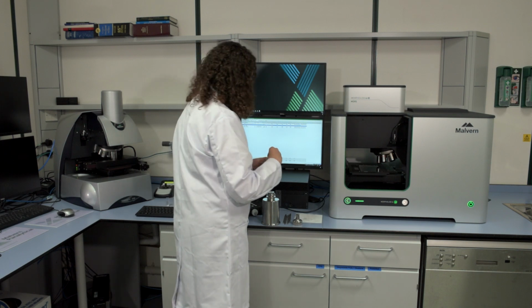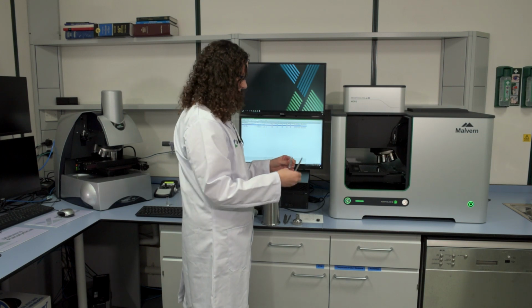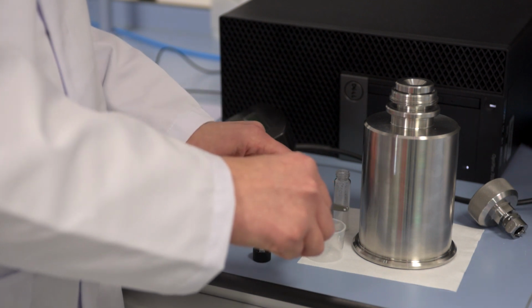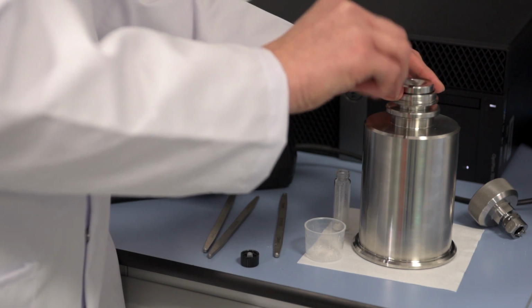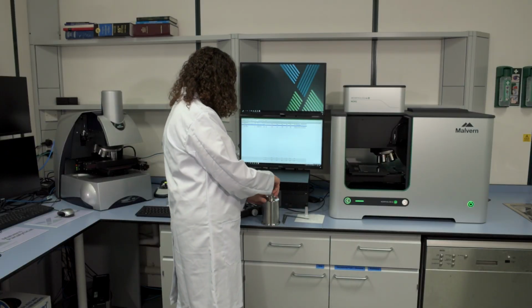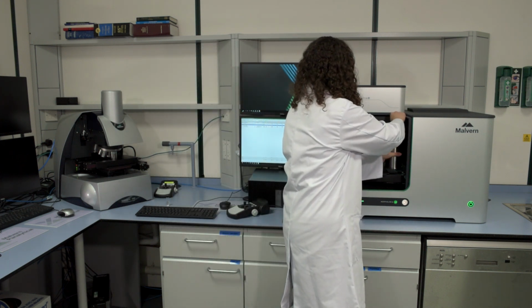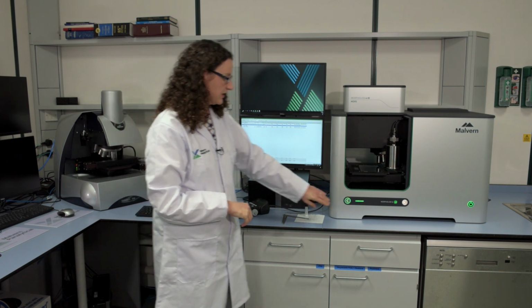Today, I'm going to disperse a sample of a dry powder. I'll use our spoons that enable us to take a precise amount of powder and put it into the dispersion unit. I'll just use a second one to level it off. And in the sample goes. I'll then place that into the system and connect the air supply. At this point, I need to close the door whilst I start the measurement, but I'll open it again later to let you see what's happening.